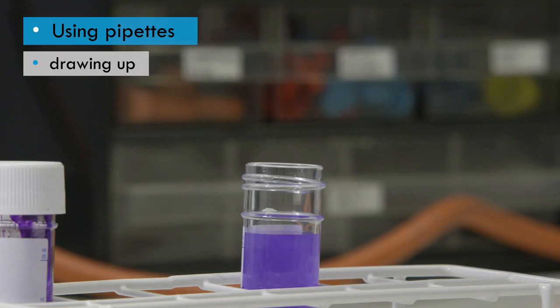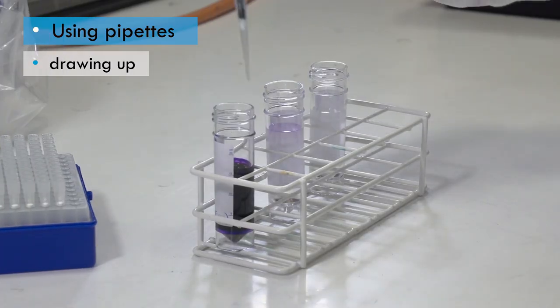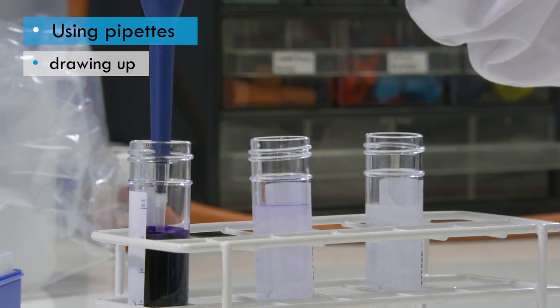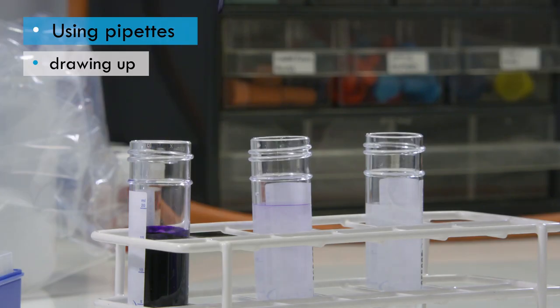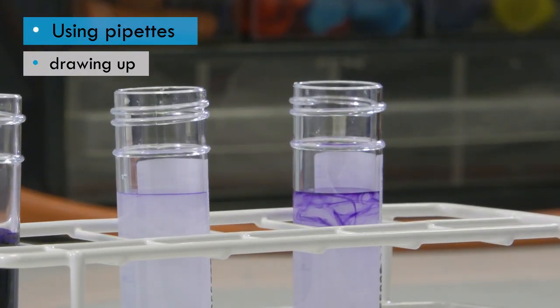When drawing the liquid into the pipette or tip, place the tip just below the surface of the liquid so that you can draw up liquid without drawing up any air. You should avoid getting liquid onto the outside of the pipette tip. As you can see, this adds significant extra material to the transfer, which will reduce accuracy, especially when pipetting small volumes.